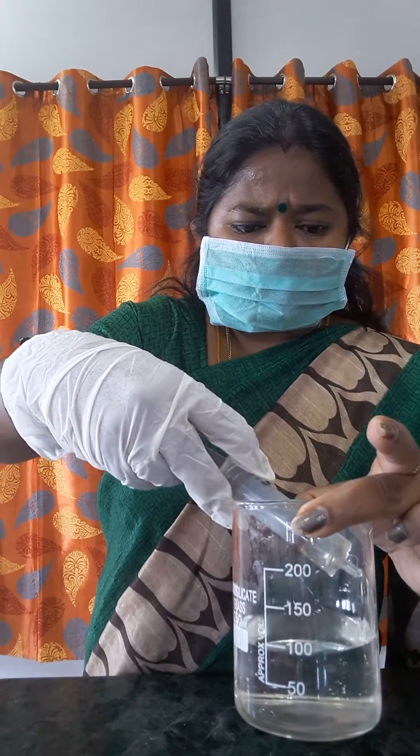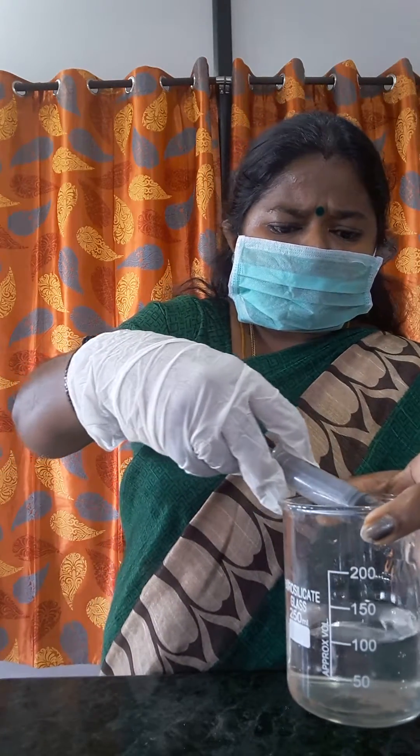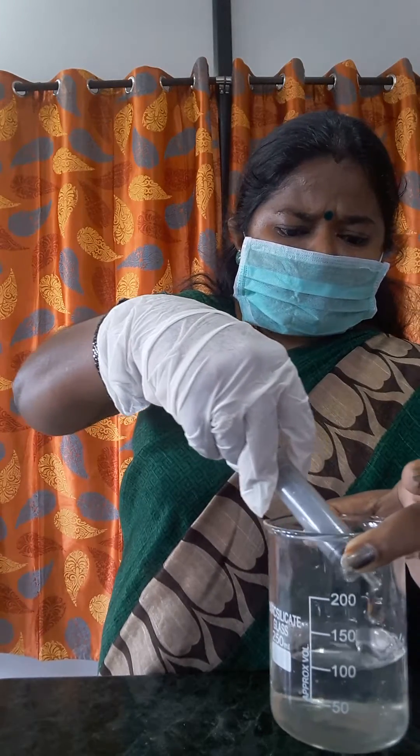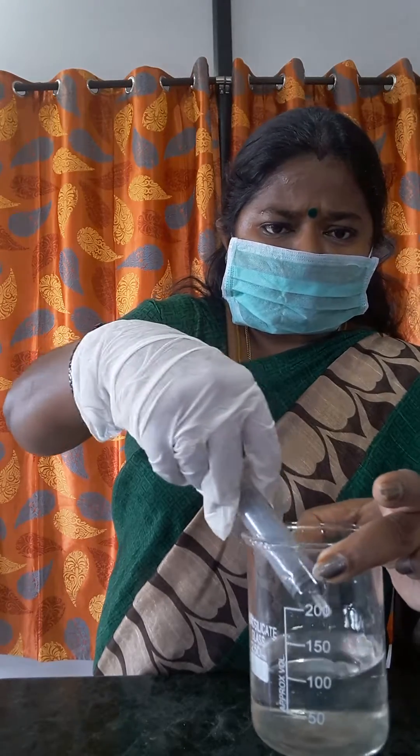Can you see? In the sides only you should put. Otherwise there will be acid spray, which is not safe for us.